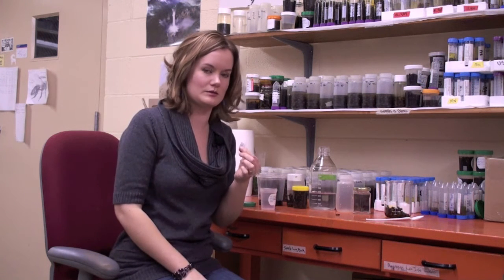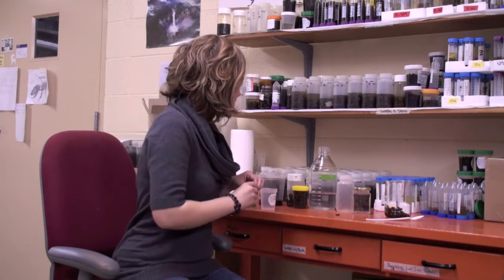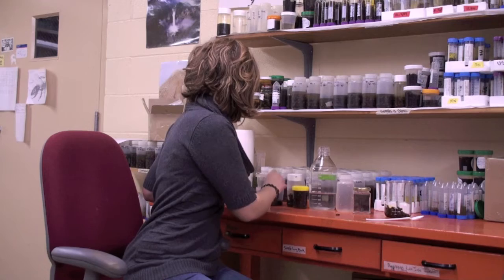You just need to get a little piece of paper. It doesn't have to be perfectly cut like this. You can just rip it off and write with pencil your initials and the colony number. And you'll stick it inside with the submerged alcohol. That way I have all the information I need when you send me your sample.